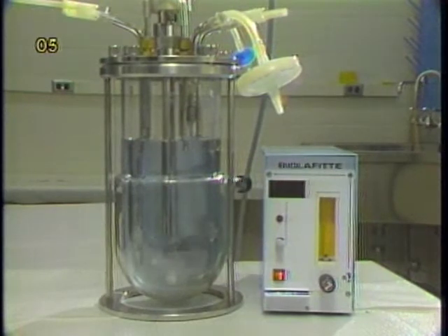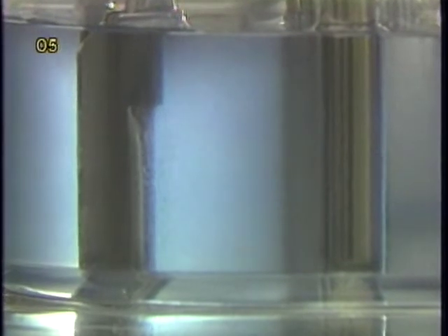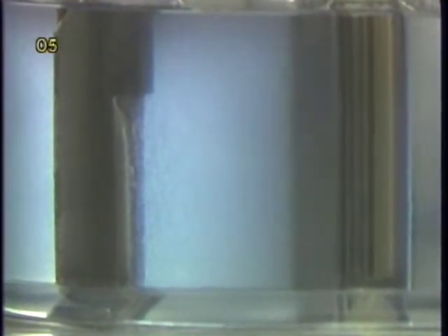An easy way of designing your own impeller is to use a glass jar with an impeller attached to an agitator. The blades of the impeller can be modified by attaching plastic plates to them. The agitation rate can also be adjusted. The movement of microcarriers under different agitation conditions can then be visualized by using microcarriers stained with trypan blue.